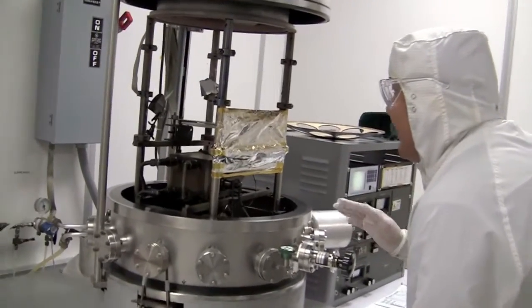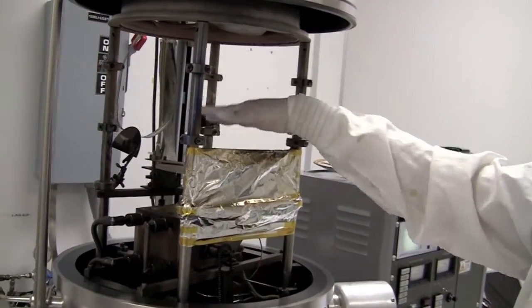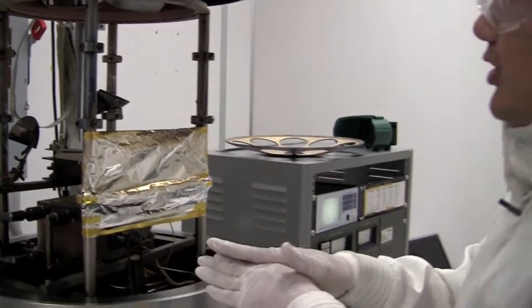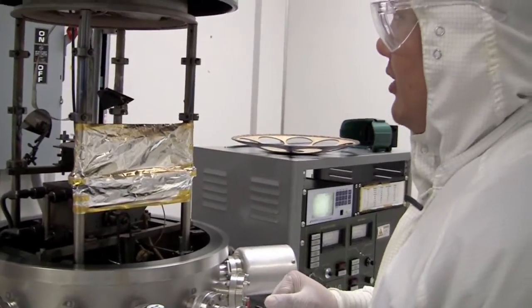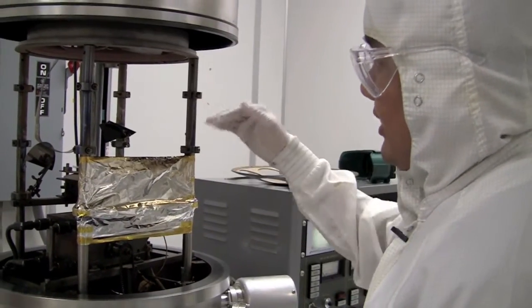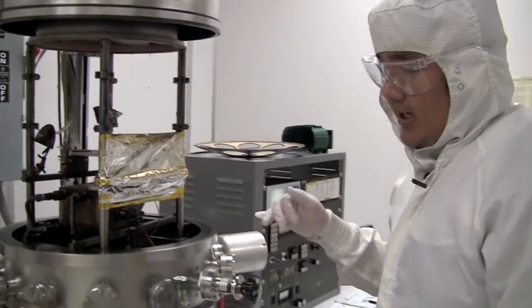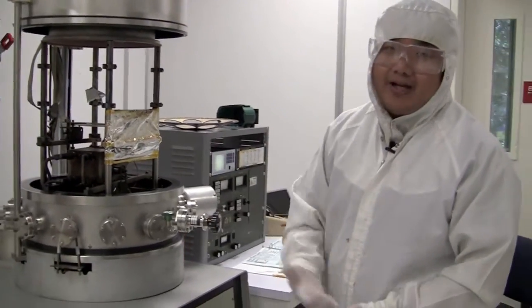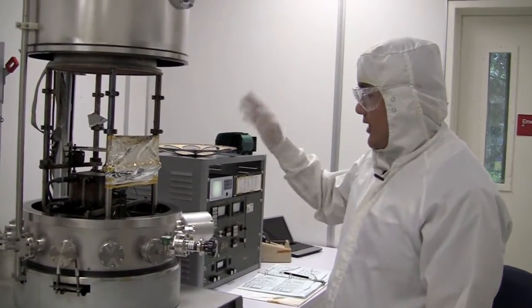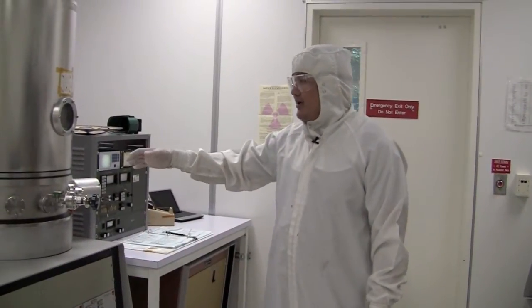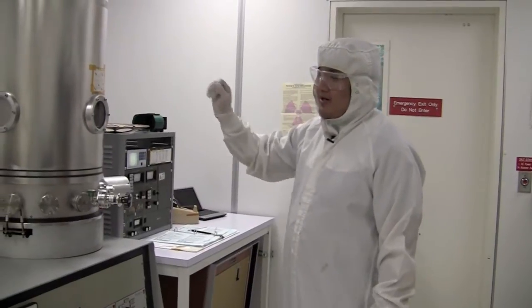So now that the sample is loaded and the substrate is there, the shutter is closed, my mirrors are in the right position, and we have the sample up here mounted securely, we can bring this chamber down and put it back into high vacuum.